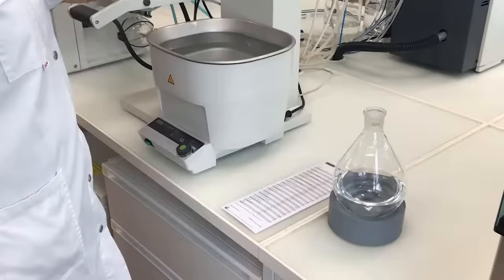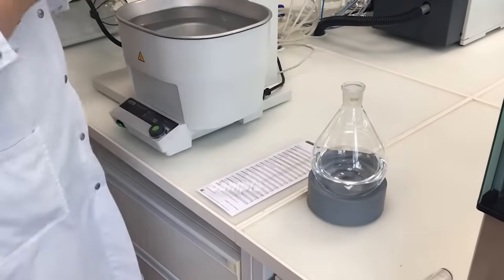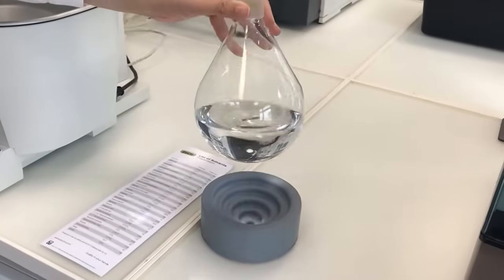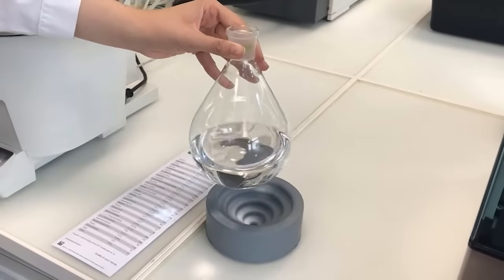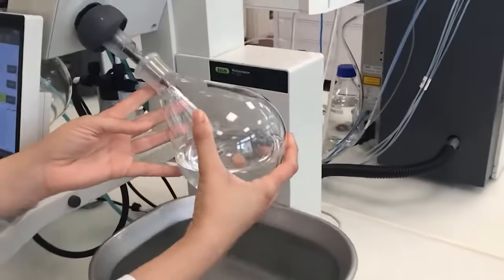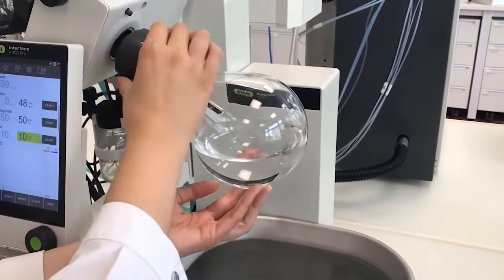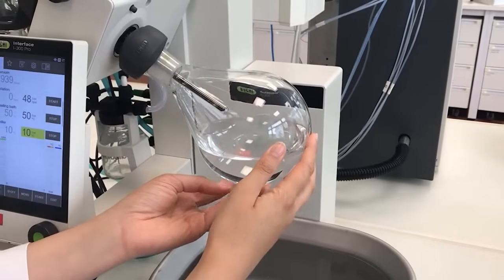Now let's get to the sample. Here is our flask with the sample — we filled the 1-liter evaporating flask to half of its volume. The bigger the flask the better, since the surface area will be larger. Next, we attach the flask to the vapor duct and close the combi clip. We recommend not to tighten the combi clip too much since we will be under vacuum.